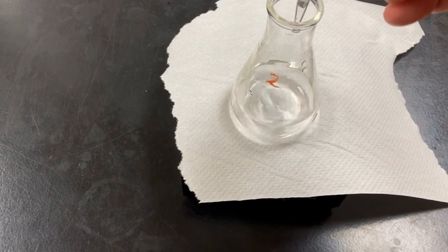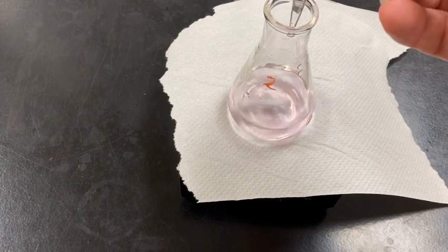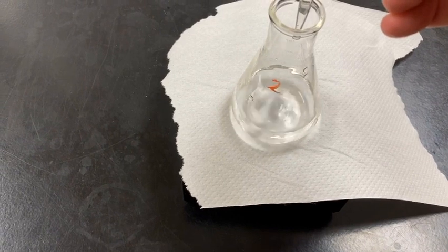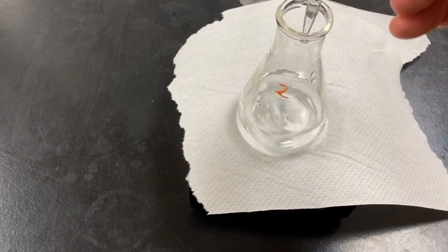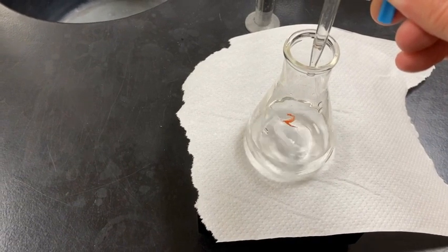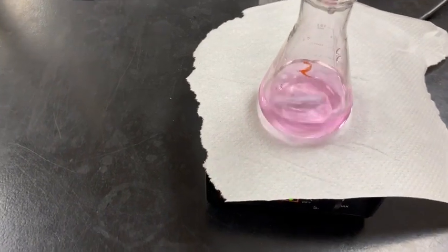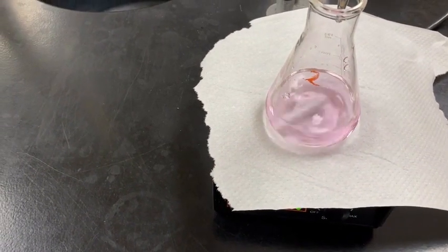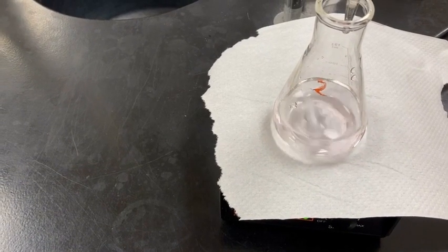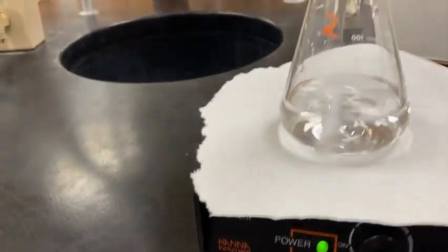That did not take much. We're pretty close. I'm going to try to add this last drop here. See where that puts us. Try not to mess it up. There we go. Let's see how long that persists. All right, this is what I'm going to do, class. Oh no, would you say it's still pink?